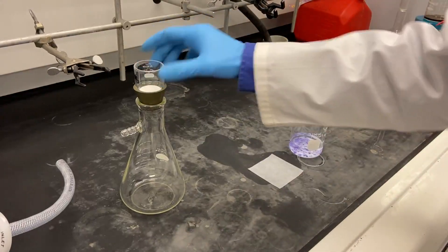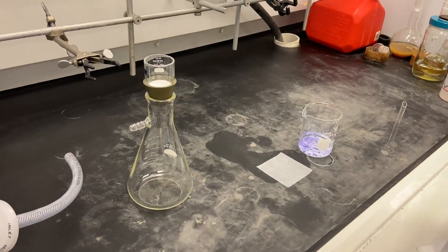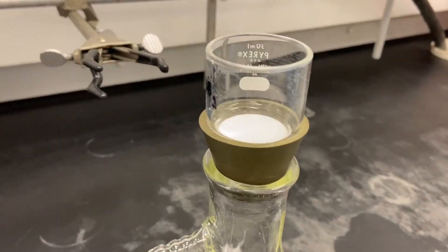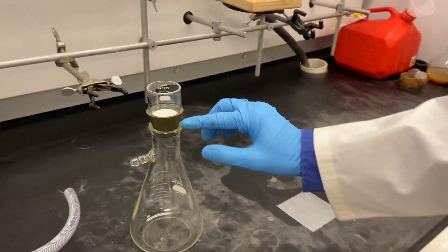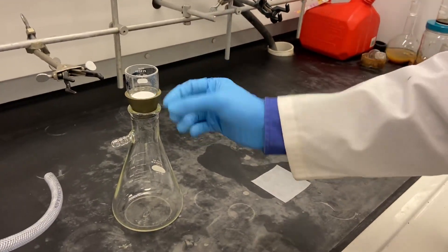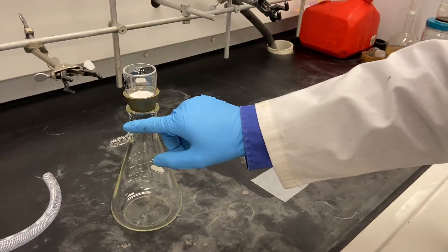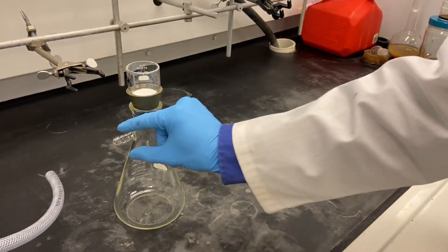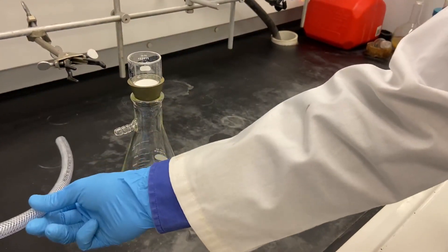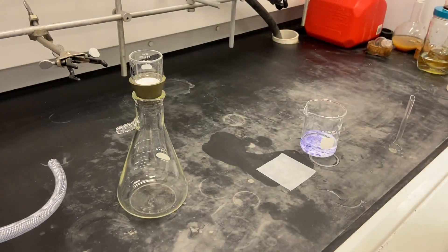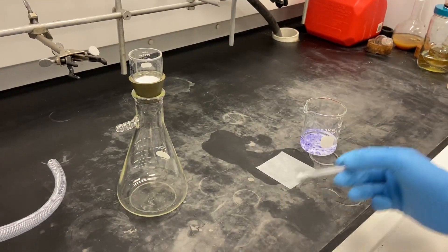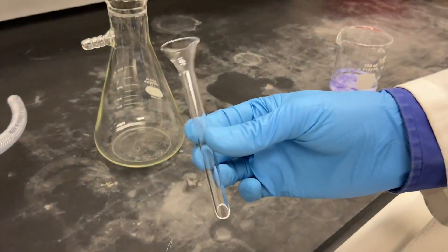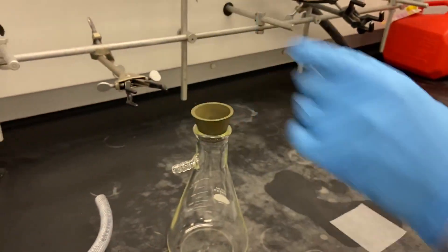Most people use it somehow like that, but in my opinion what may happen is the liquid will go just everywhere and it may escape through this adapter and go into your pump. So if you want to avoid that, there's a special small funnel that we can just insert here.